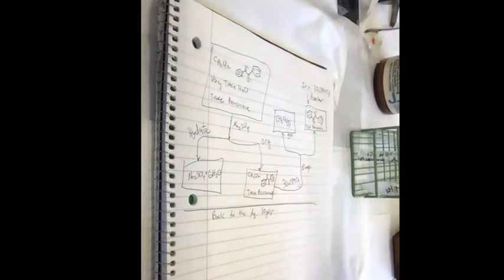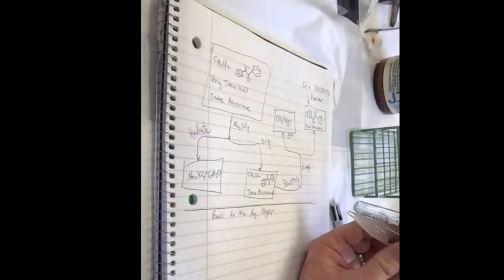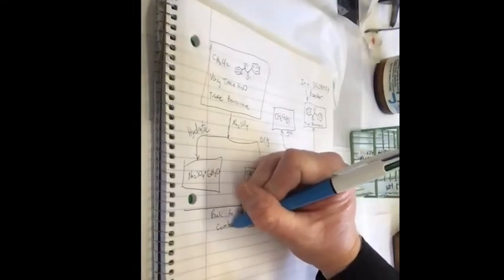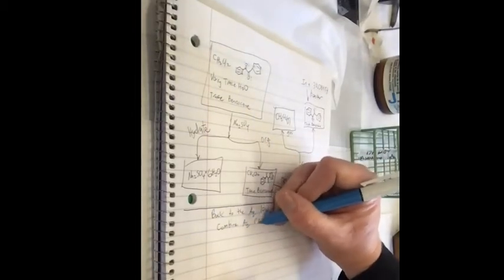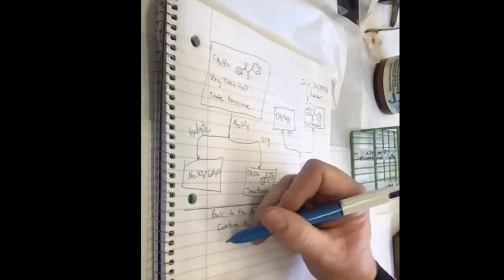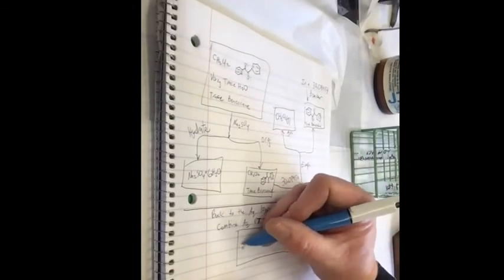Okay, so back to this layer. I'm wondering if I'm gonna be able to fit them both into here. I think I can. I want to combine them and then extract them. So I'm gonna combine aqueous precipitate 1 and 2. So in that, I will have benzocaine.